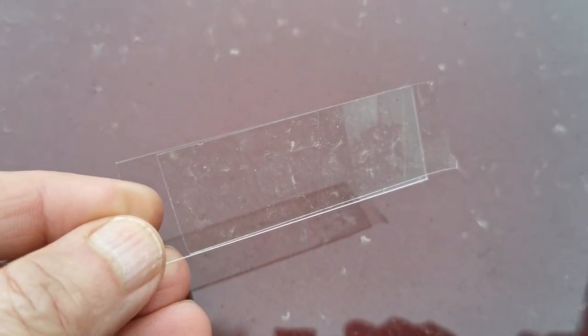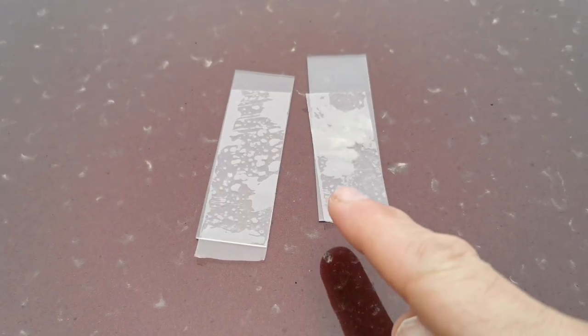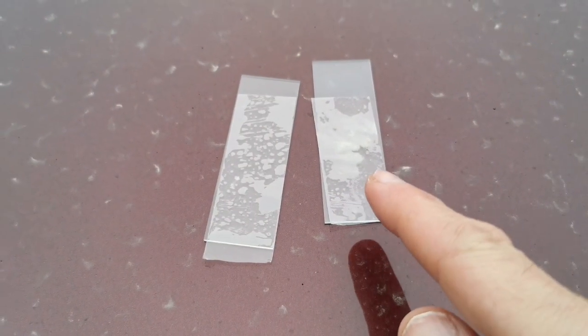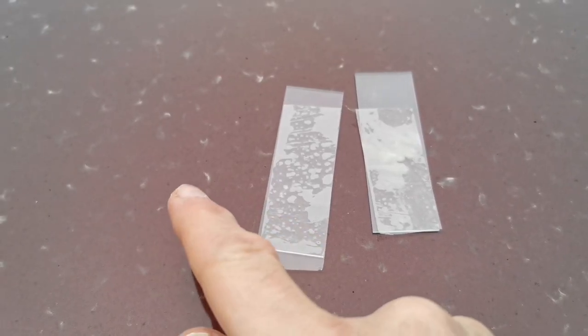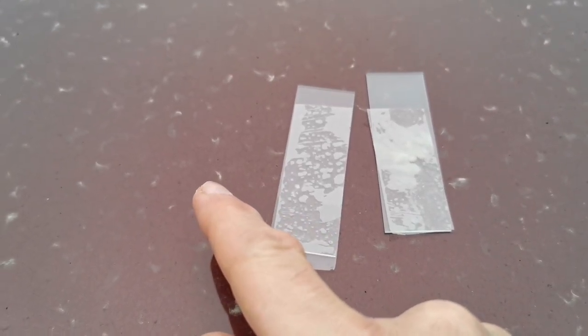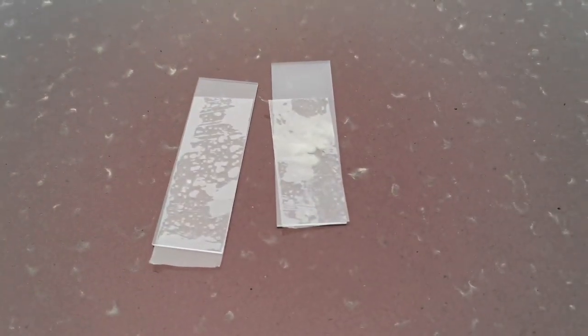And now I take a sample of the pollen from a yew tree. Okay, this is the pollen. I took it right now from the tree. And this is the sample of this material, which can be dust or pollen, from the car after the rain. So you just go and compare them now.